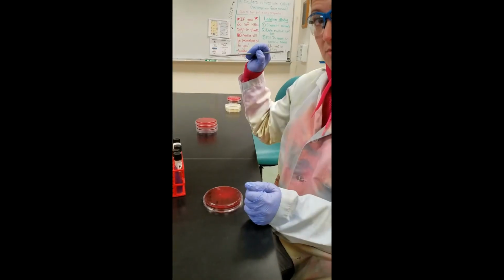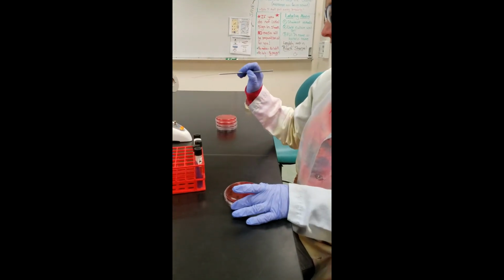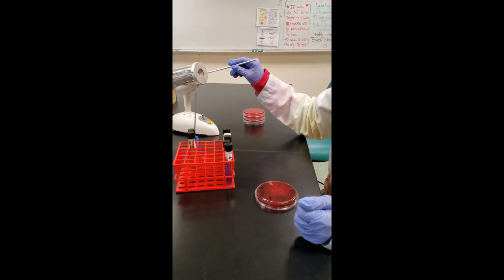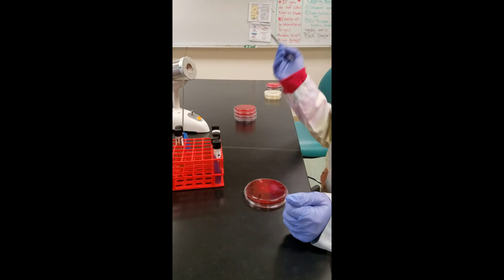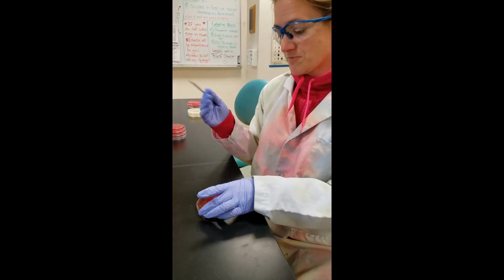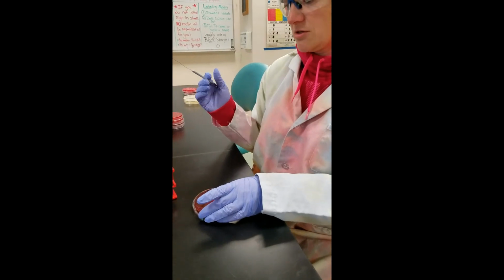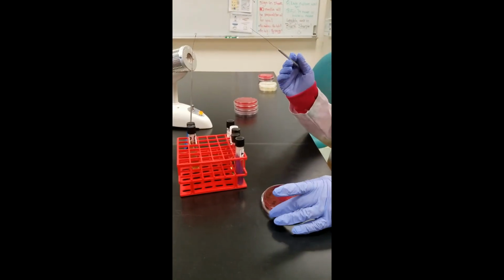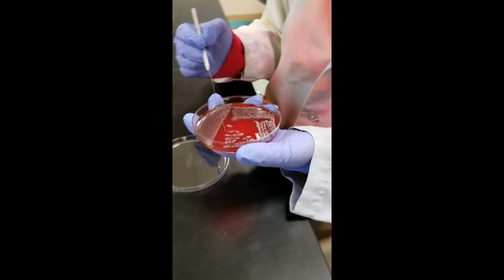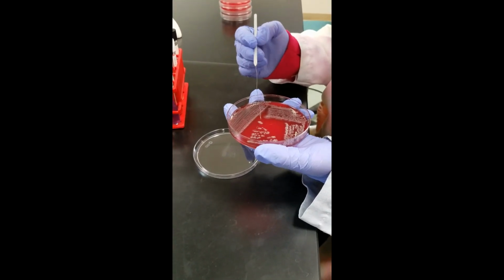So we're going to set up our biochem tubes, inoculating all 5 of our biochem tubes. Again, our 5 biochem tubes are to help sort out gram-negative rod bacteria. So we're going to use the needles that you guys didn't get a chance to use this semester. I am going to be inoculating all of my tubes today in the video using E. coli bacteria. So now that my needle is cooled off, I'm going to pick up an isolated colony of bacteria.